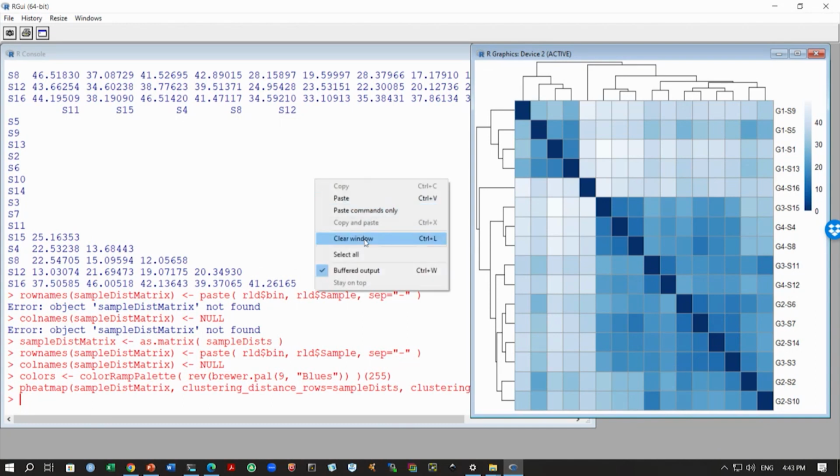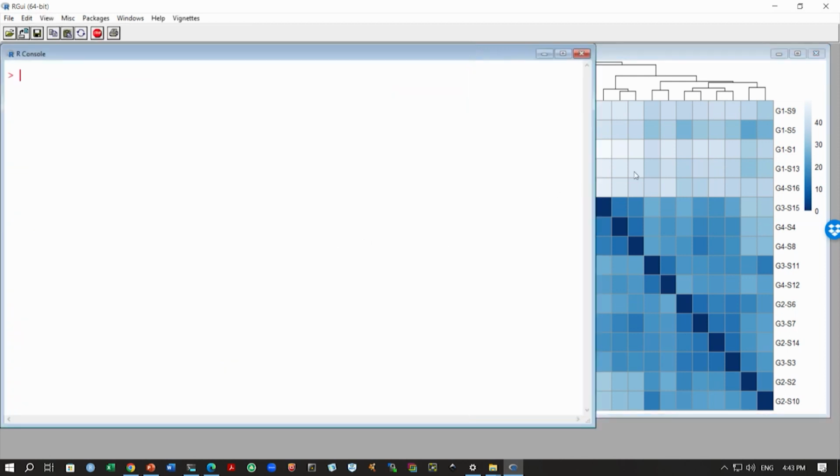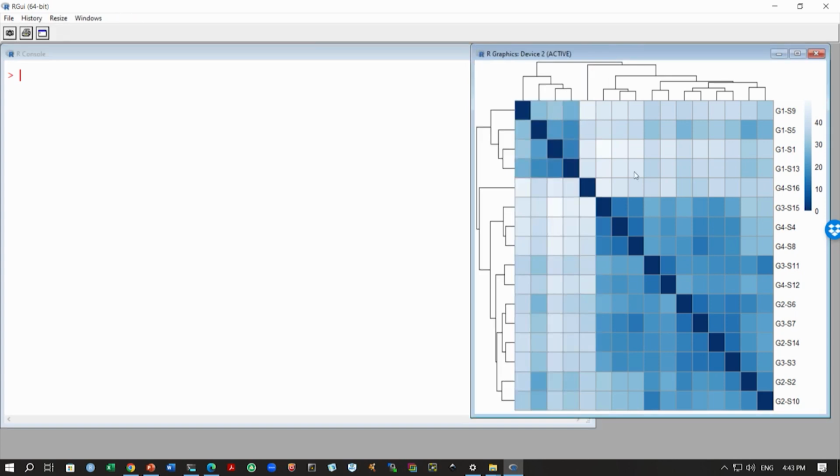One of the things I just wanted to mention is that we used Euclidean distance. First we did something called an R-log transformation here, and then calculated Euclidean distance between the samples. Now, what will the R-log transformation do? It will reduce variability, as we saw in our data, for the genes that have low read counts. So, in that case we can use Euclidean distance.